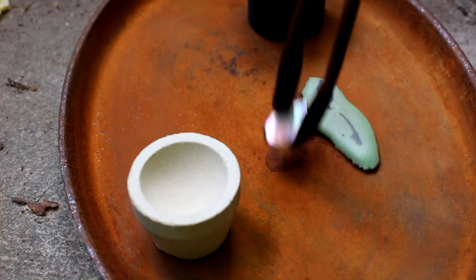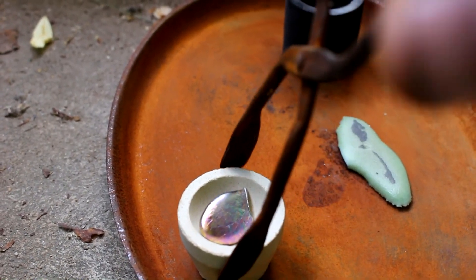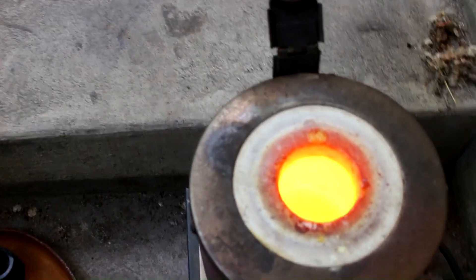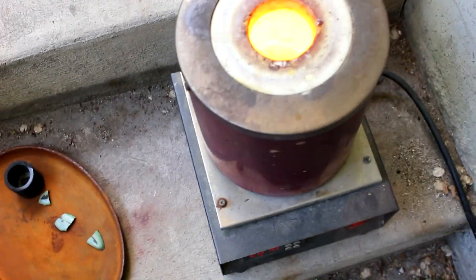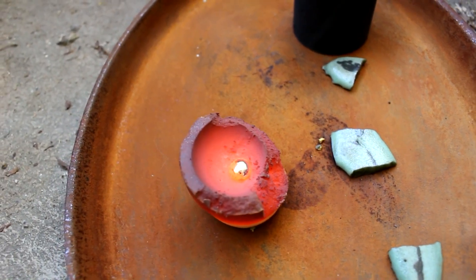To do that, I'm going to put the metal into this little porous dish, which will absorb lead oxide but won't absorb lead metal or silver. I just put this in the furnace to oxidize the lead. As you can see, the cupel broke, but I got it out. And there's a nice large bead of silver. Awesome.